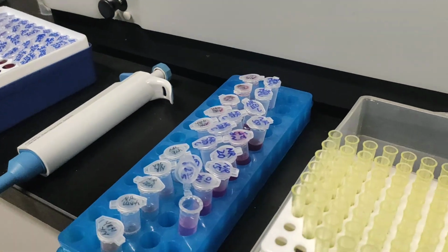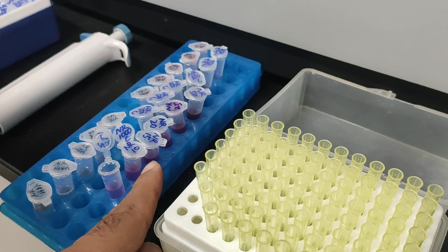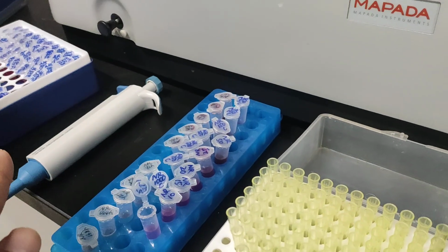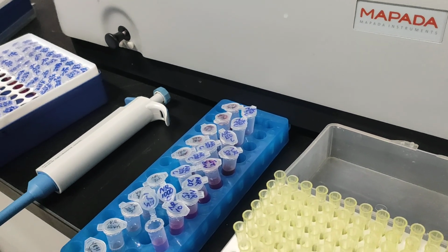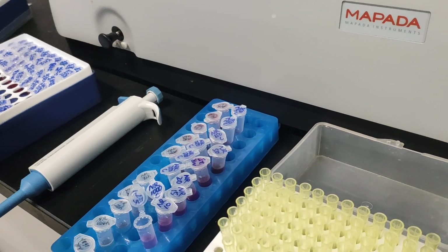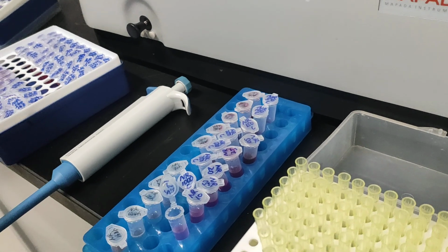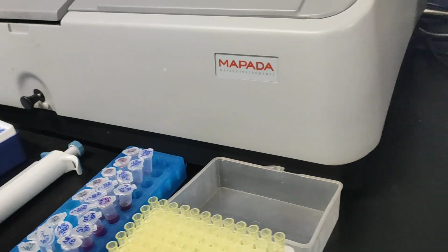For example, here we will first prepare the standard solution from our samples. And if you measure, start from low concentration to high concentration. For our experiment here, for the fermentation process, we will start from the old one to the new one, because in our experiment, for example, we will try to measure the ability of microorganisms to consume or immobilize some dye from the media, and we will see the result of our experiment here.